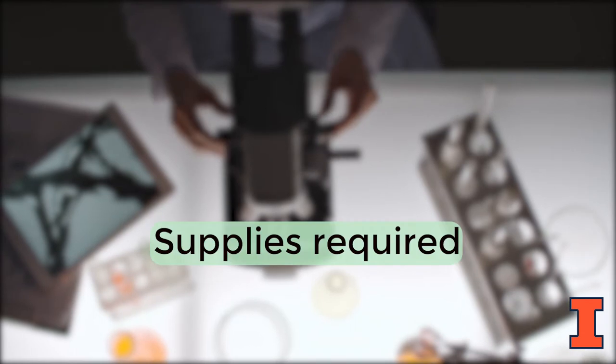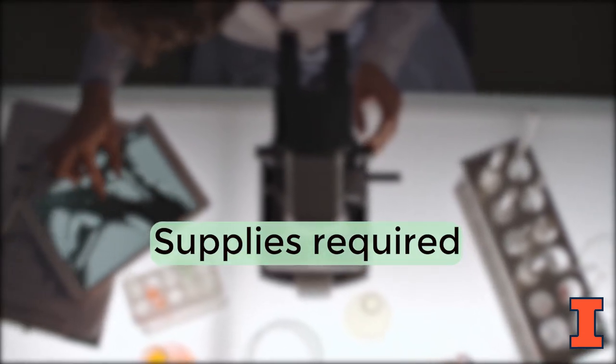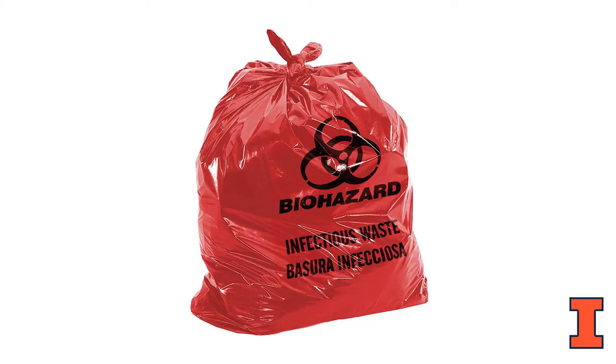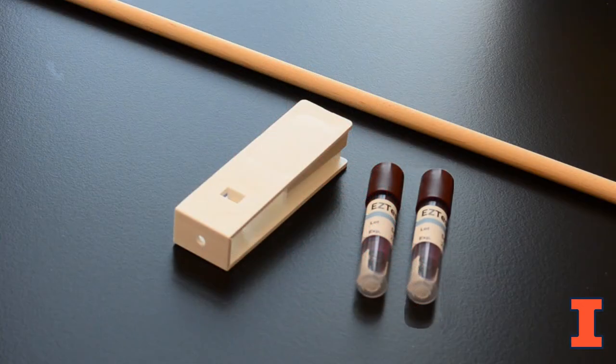To prepare for the validation, you will need the following items: a representative bag of biohazard waste equaling in size and volume or fullness to most of your other waste generated. DRS recommends not letting your autoclave bags get more than 75% full. A starter kit obtained from DRS containing test and control spore vials, a crusher tool, and a wooden dowel.